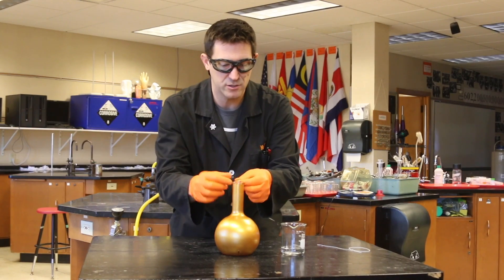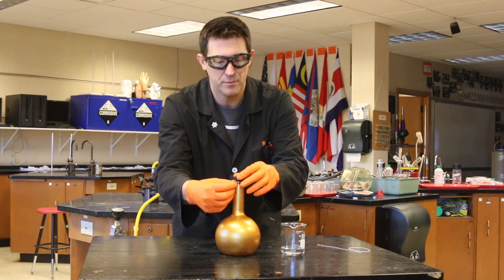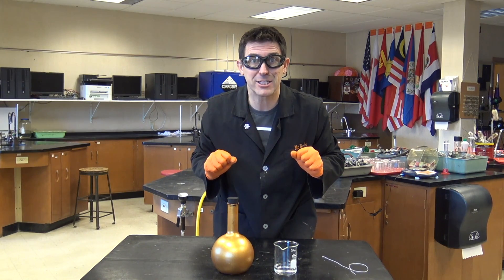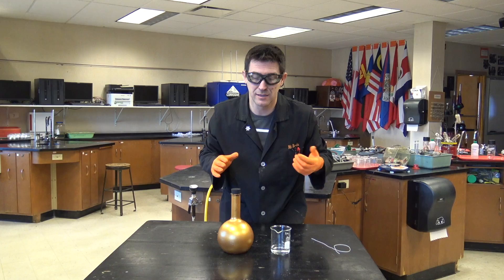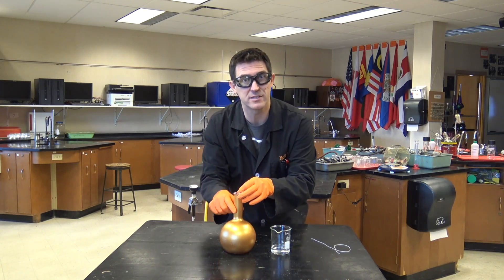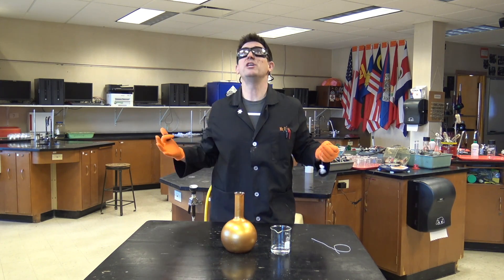I'm going to set this in here so just a little tiny bit sticks out, and put the rubber stopper in. Now you can't see the catalyst. Magic — or more science. When I pull this off, that's going to fall down inside of the hydrogen peroxide. And we've got a genie shooting out of the bottle!